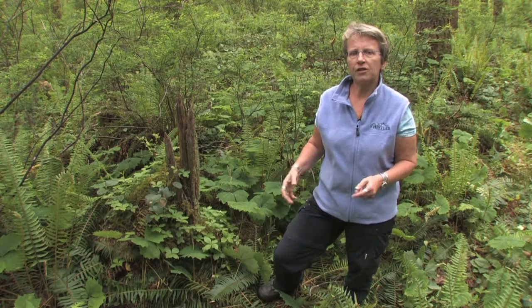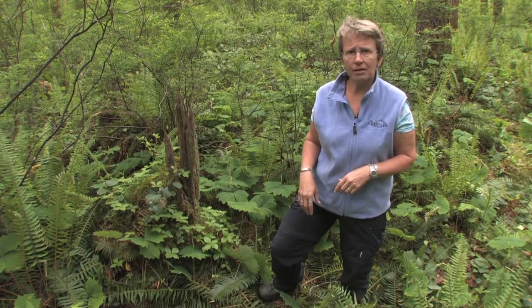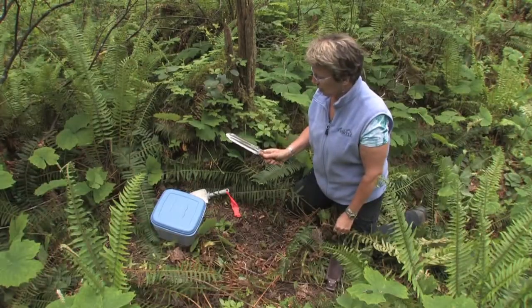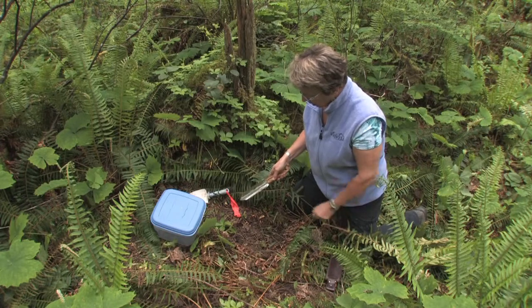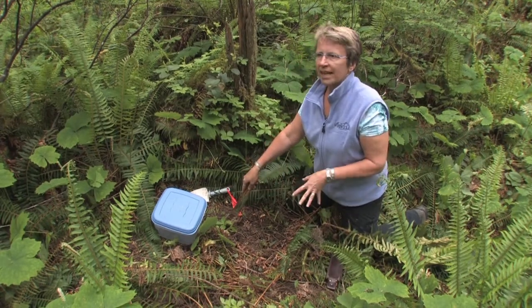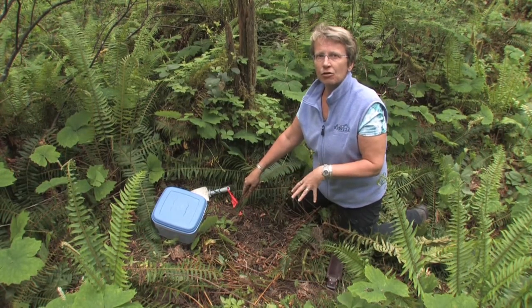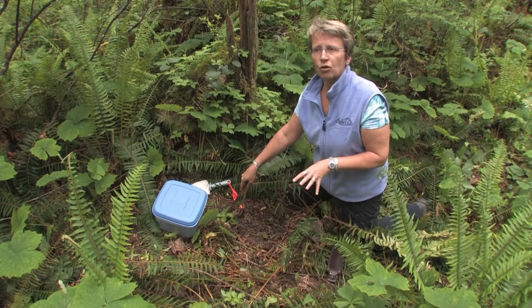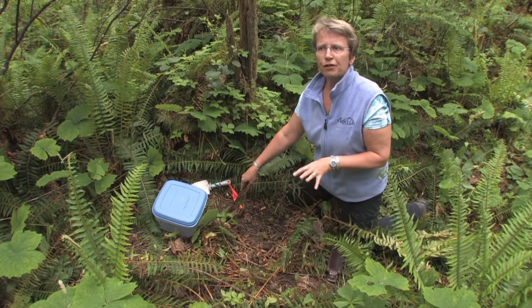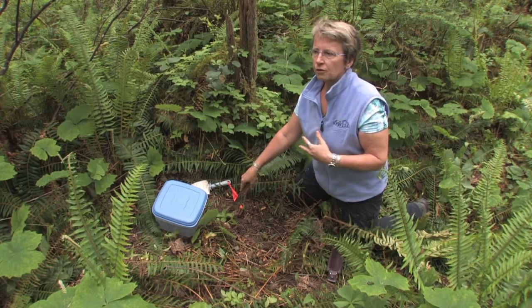In order to look at the macro fauna, we have to take a large soil block, which is then taken back to the lab for hand sorting. I'm going to demonstrate how we take that soil block now. We use a Japanese sampling knife to take a square of soil, and what we're taking is the whole of the organic layers down to three centimeters into the mineral soil. The organic layer of soil is really important for soil fauna — it's where you find 95 percent of the soil animals.